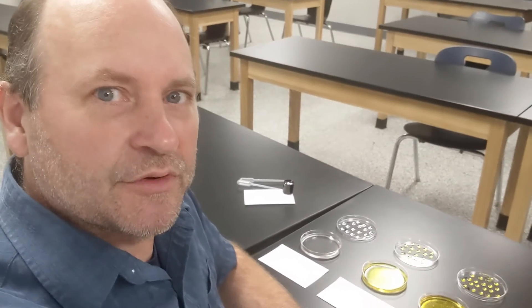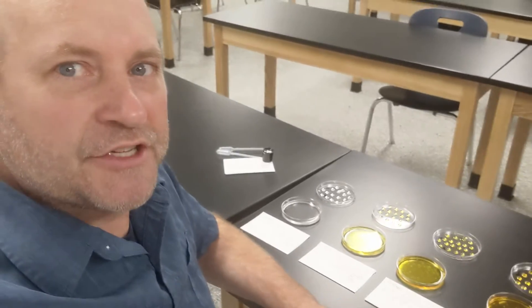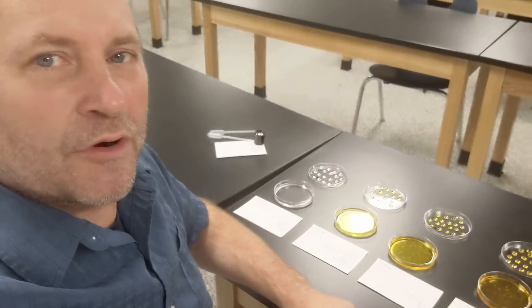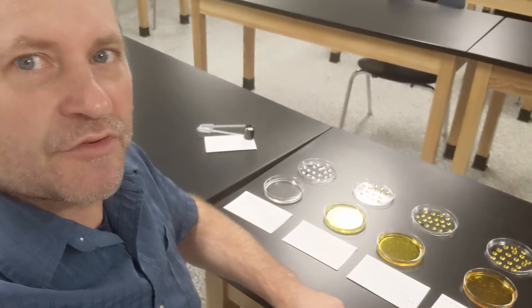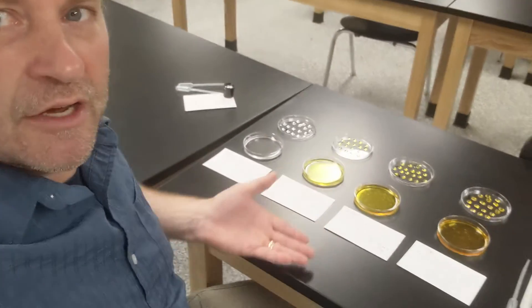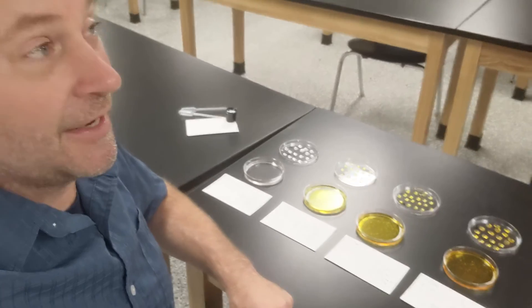So all we have left to do now is build a chart and write our lab report. You can find the instructions for writing that lab report on Canvas. Go ahead and use this data.